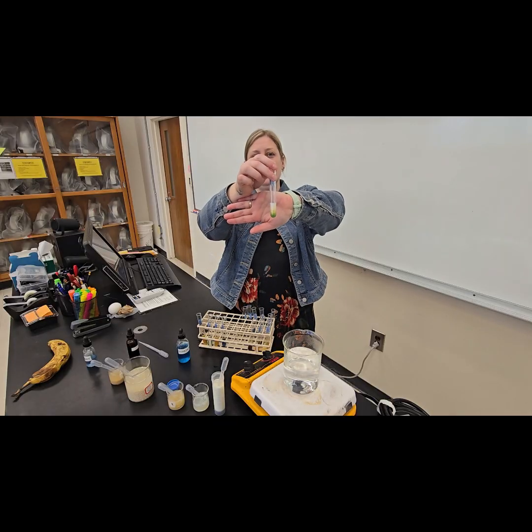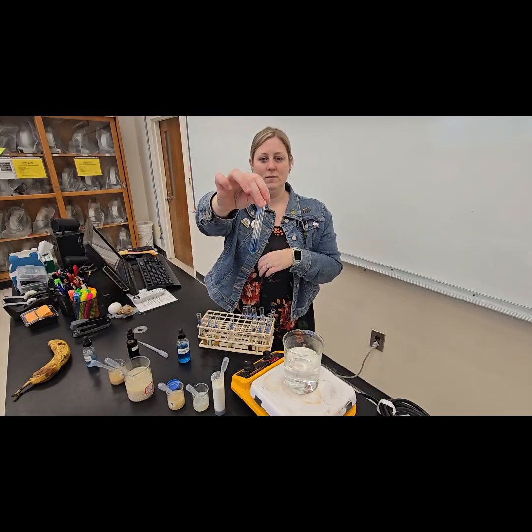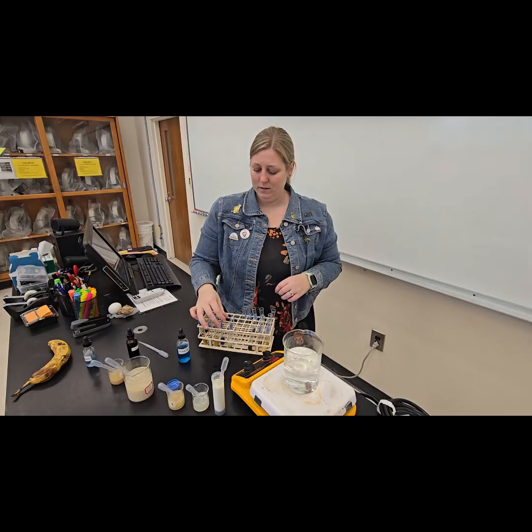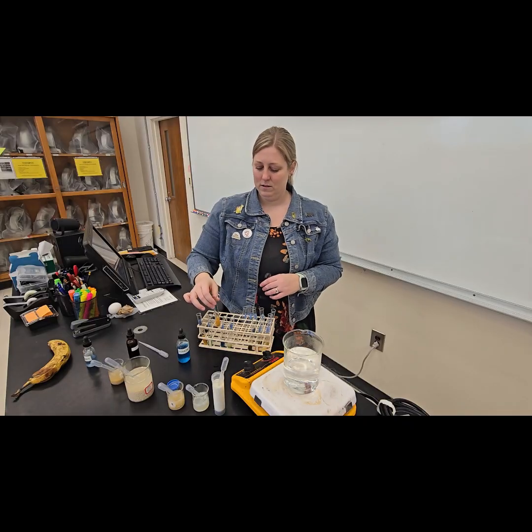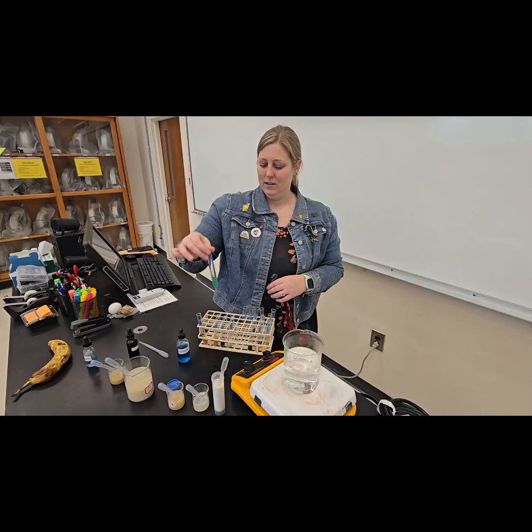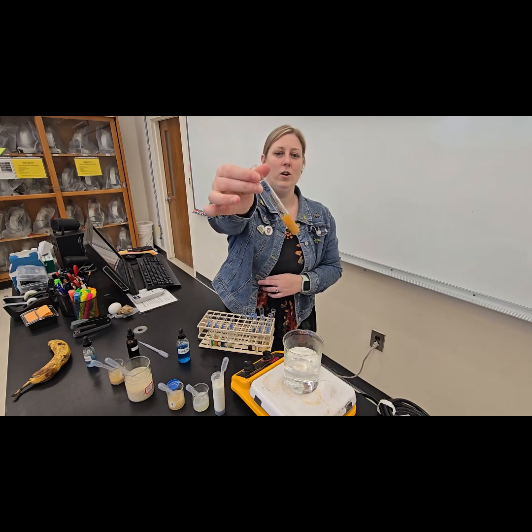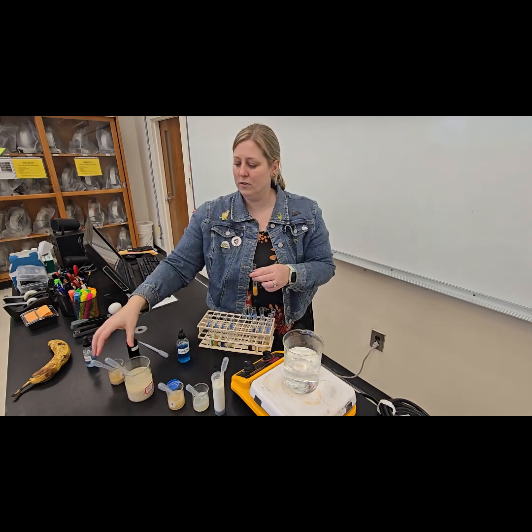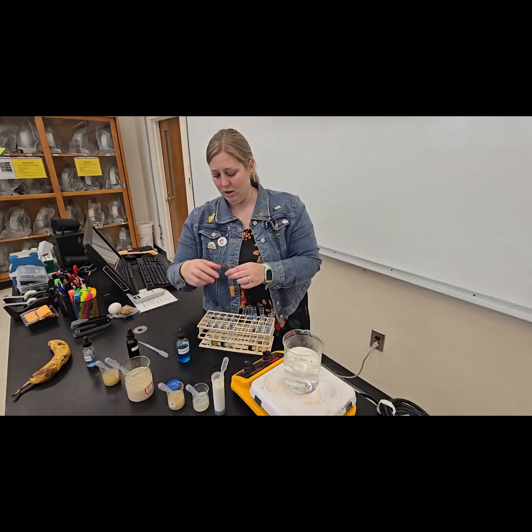We have our milk, okay? We have our albumin. We have our banana. We have our rice water. And last but not least, we have our unknown, which, to remind you, the unknown does have a faint beige color. So we have our unknown there.